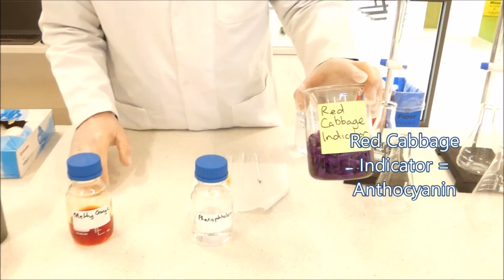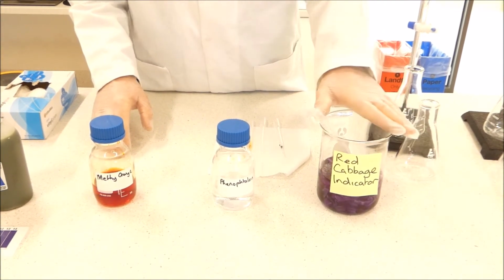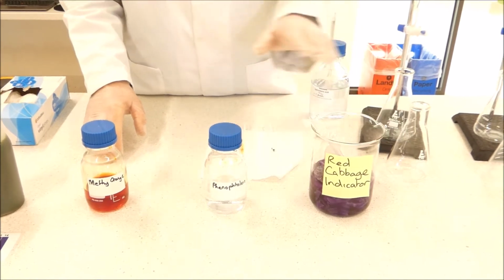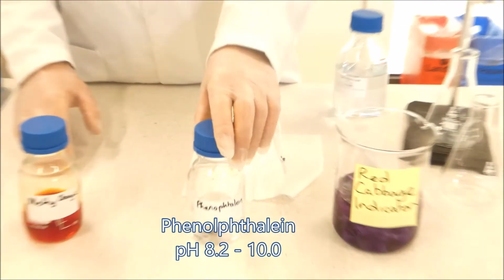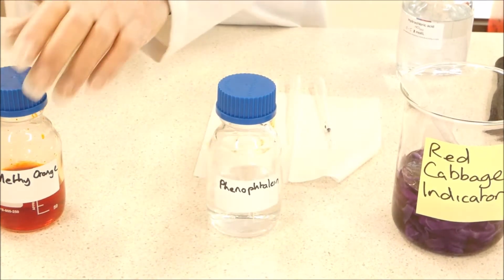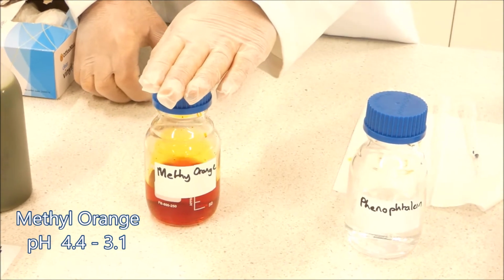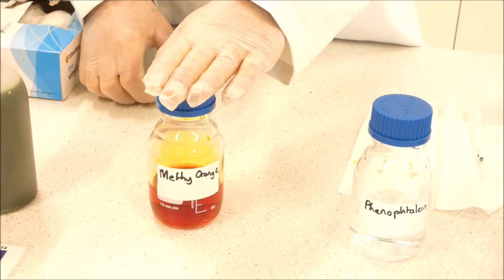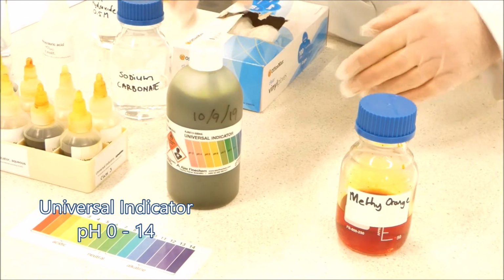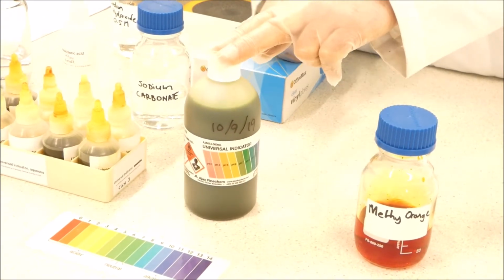We're going to make an indicator out of red cabbage, which contains anthocyanin, which makes something almost like a universal indicator. We've got phenolphthalein, which detects basic solutions and turns a lovely pink-red colour. We've got methyl orange, which goes from blood red to orangey yellow in acid solutions. And then of course, we've got universal indicator, which has a huge range of colours across all the pHs.